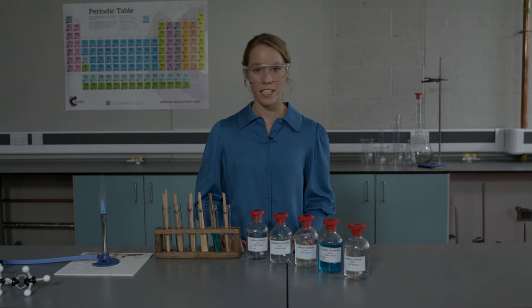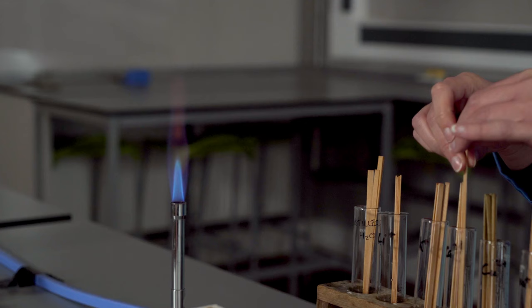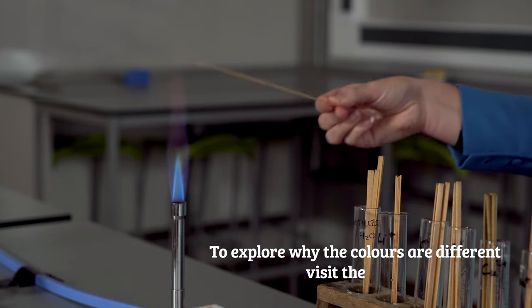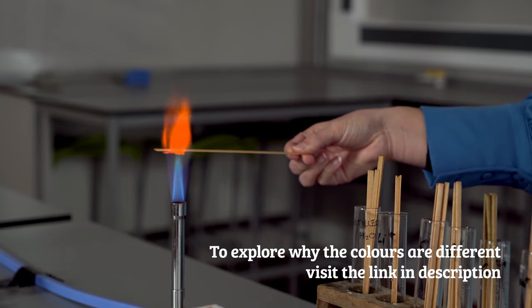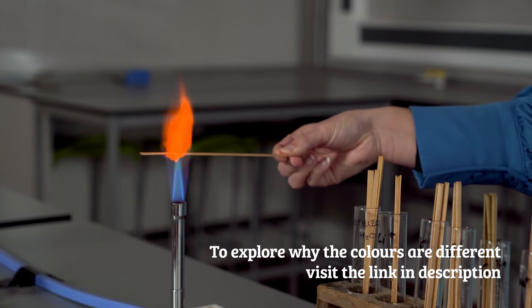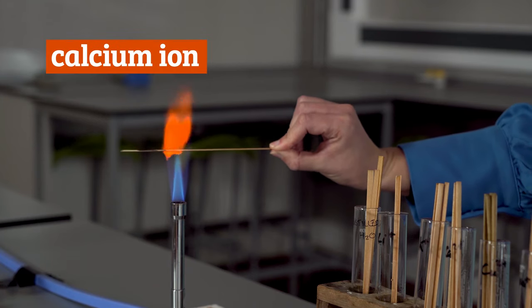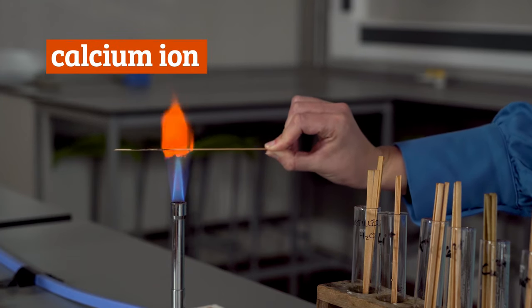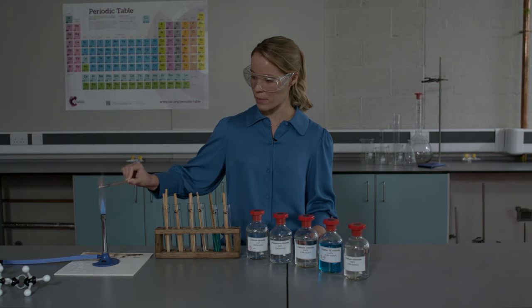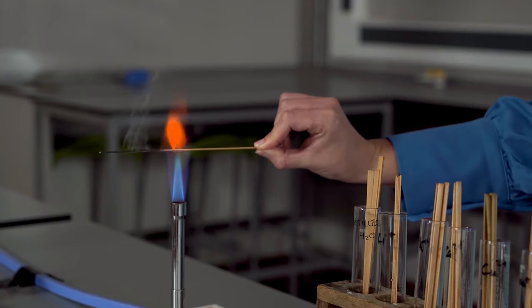Now I'm going to test the calcium ions. We can see a red color, but this time it's an orange-red. This is why we need to be very particular when describing the flame color of lithium and calcium.